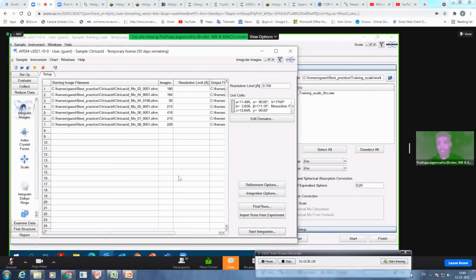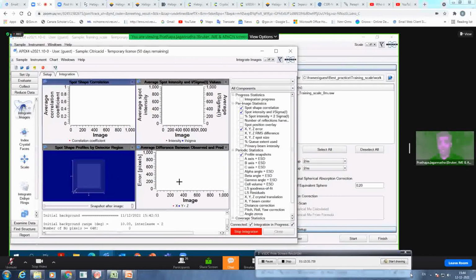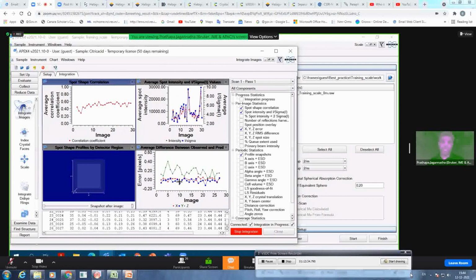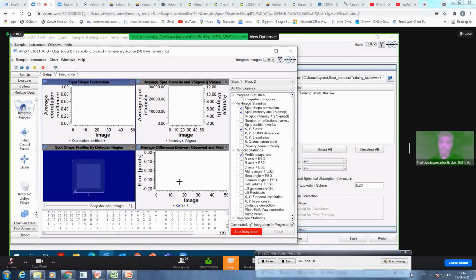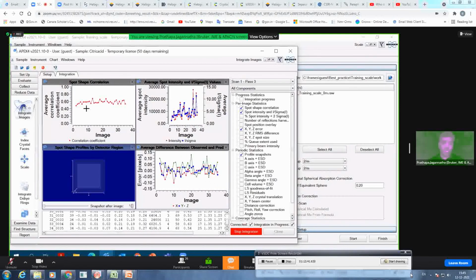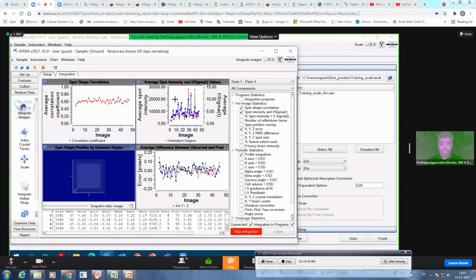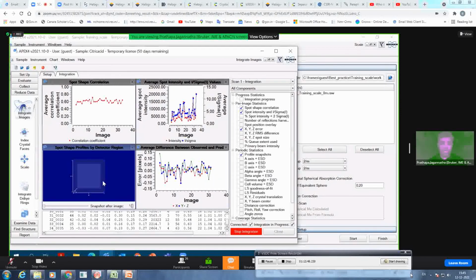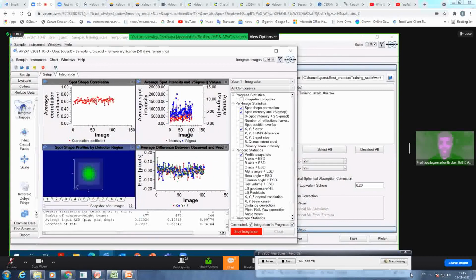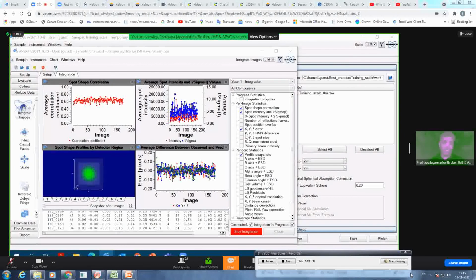Whenever I want to reintegrate, it will always ask me to overwrite. So I overwrite. If you do not want to overwrite, you just save it under a different name. So you can see here, these are the four graphs I was talking about: average correlation coefficient, average intensity versus the image, the 3D profile box, and also observed and predicted spots. I was telling you that you don't need to look at the LS file for your frame queue, you can also have a graph here.